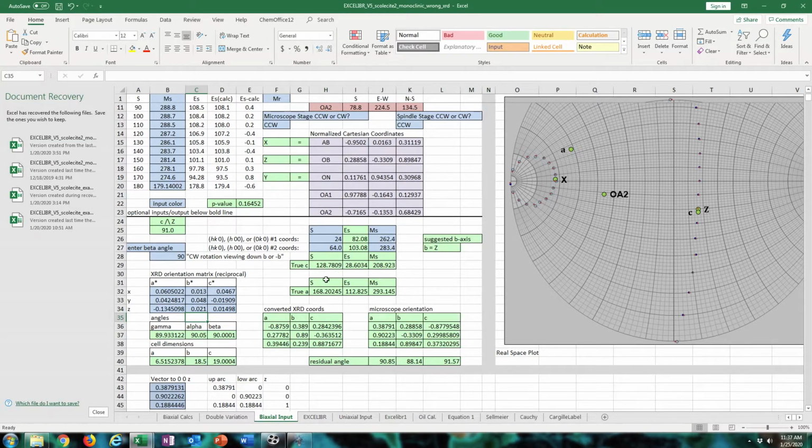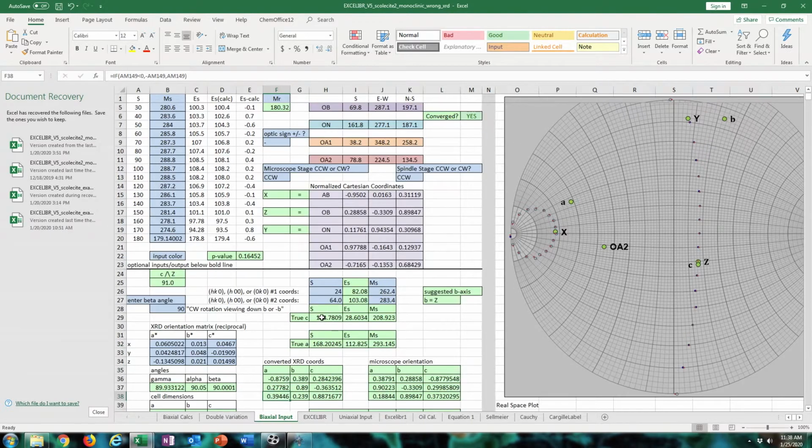I created a spreadsheet to where you can use the microscope orientation for A, B, and C as a reciprocal lattice setting. So this is in direct space, but we can just convert that to reciprocal space and scale it by the correct cell parameters to try to find the right reciprocal lattice. Yeah, as you can see, A is equal to C in this, and then B of the XRD orientation is the same as A of the microscope orientation.